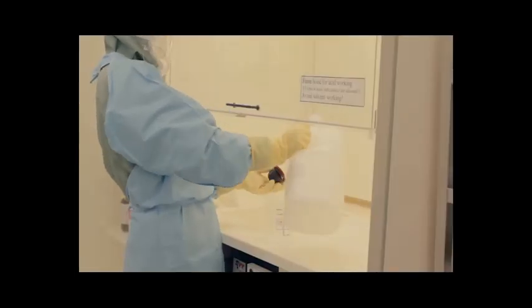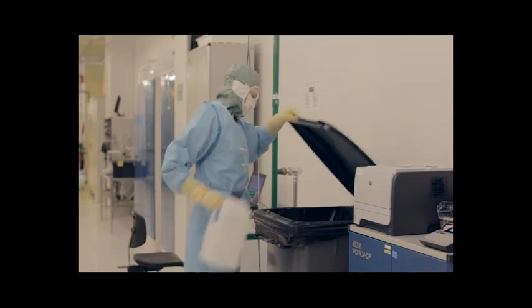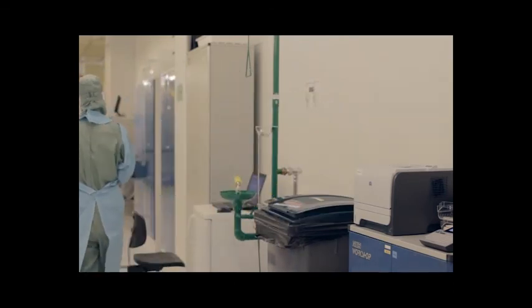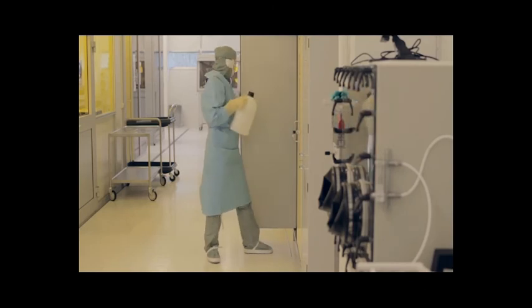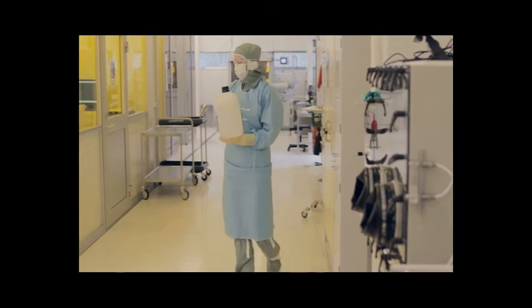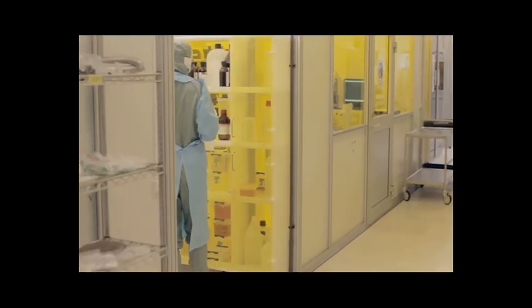When the chemical bottle gets empty, rinse it thoroughly with water and close the cap. Take the bottle into the correct rubbish bin in the service corridor. Get a full bottle from the buffer stock. Please do not take chemical bottles from another cleanroom bay. This increases the risk of cross-contamination and only transfers the problem to another person.